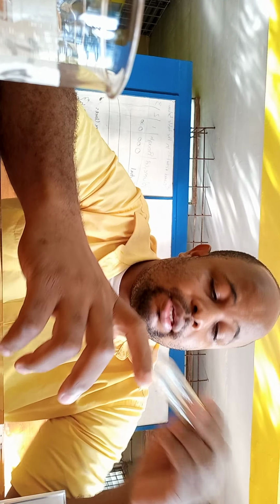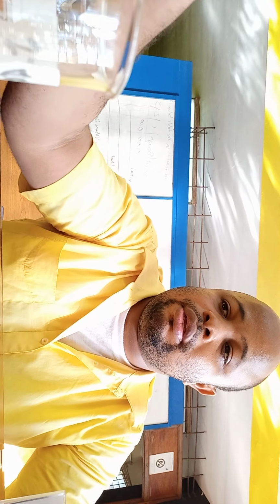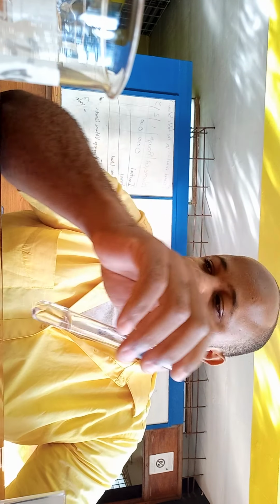Alright, so continuing. So at the end, for the primary alcohol, we should have a carboxylic acid, and for the secondary alcohol, we should have a ketone. But remember, we added acid, the sulfuric acid, as the catalyst, right? So its presence would have still been in the test tube.